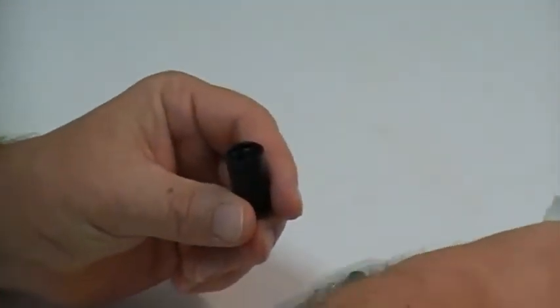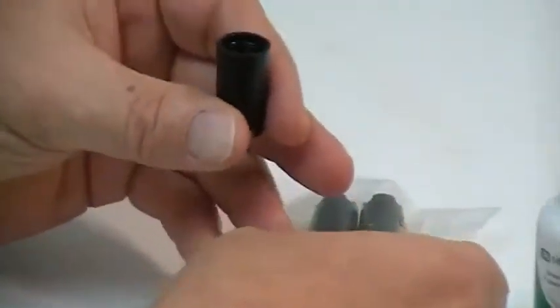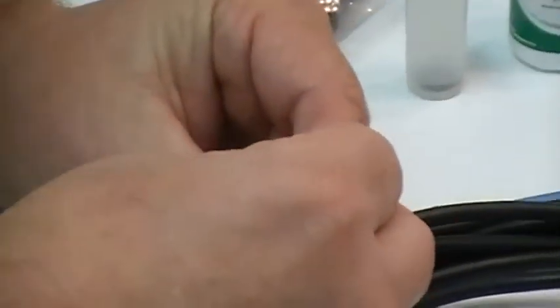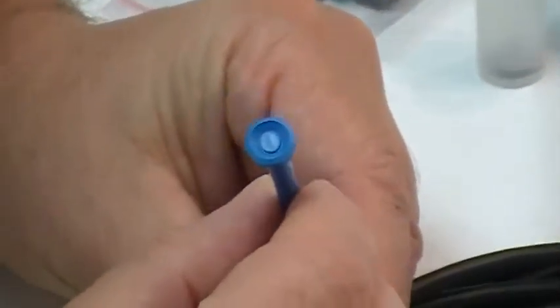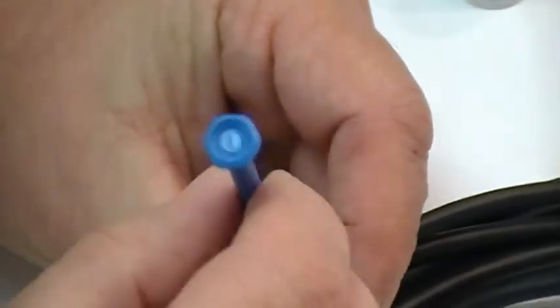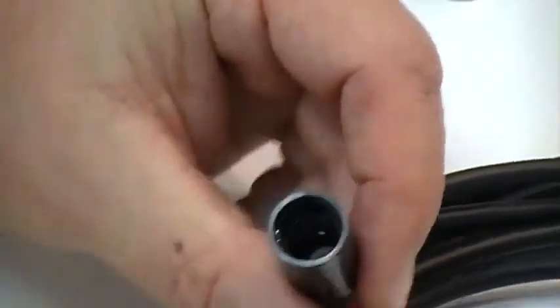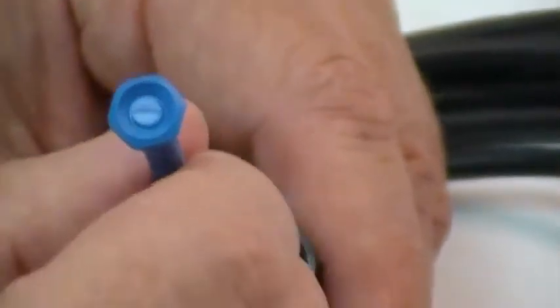Next you will take your membrane. You want to select an O-ring that came in the protective cap. Put the O-ring into the membrane and with the screwdriver, tap it down onto the shoulder at the bottom of the threads. Now this is black on black, so it's difficult to see the O-ring inside the membrane. But there is a shoulder at the bottom of the threads.